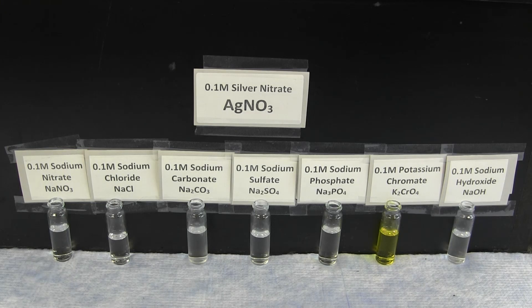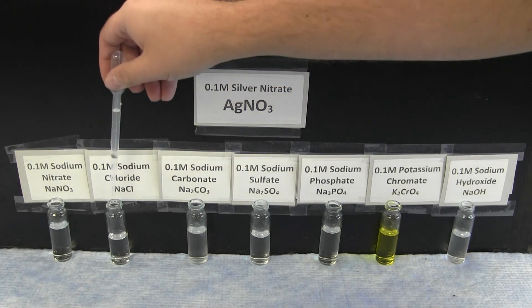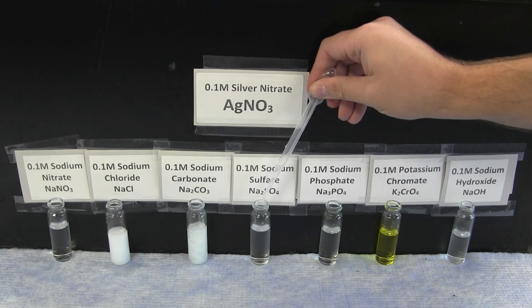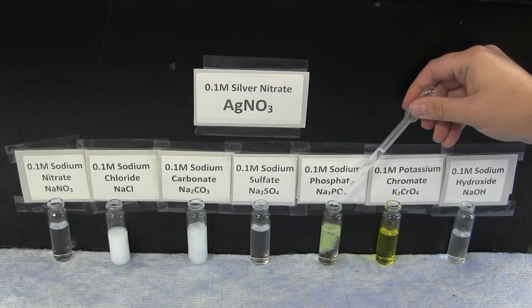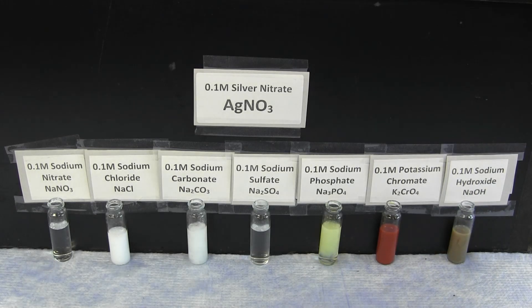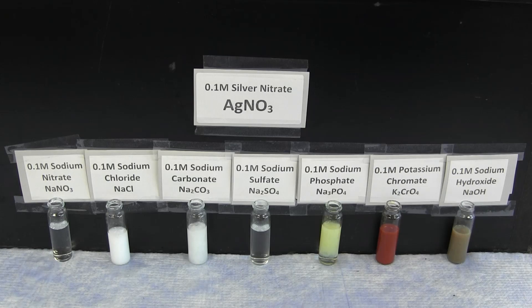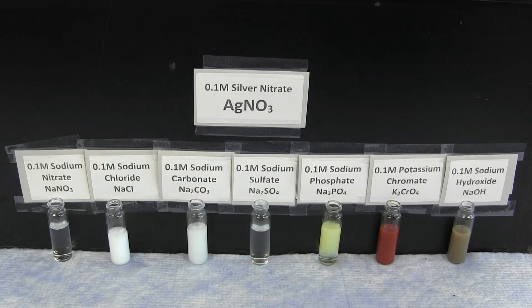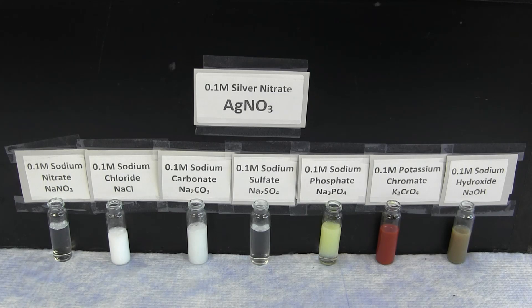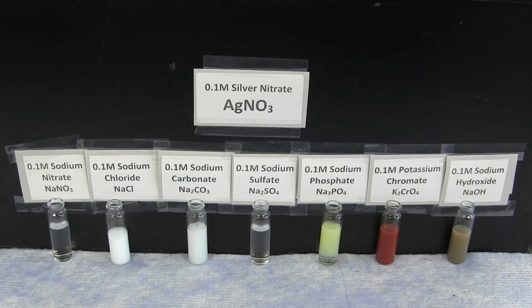The next ion to observe is the silver ion, which is uniquely reactive. Overall, the silver ion forms a white precipitate with sodium chloride and sodium carbonate, a yellow precipitate with sodium phosphate, a red precipitate with potassium chromate, and a brown precipitate with sodium hydroxide. There is no reaction with sodium nitrate or sodium sulfate.